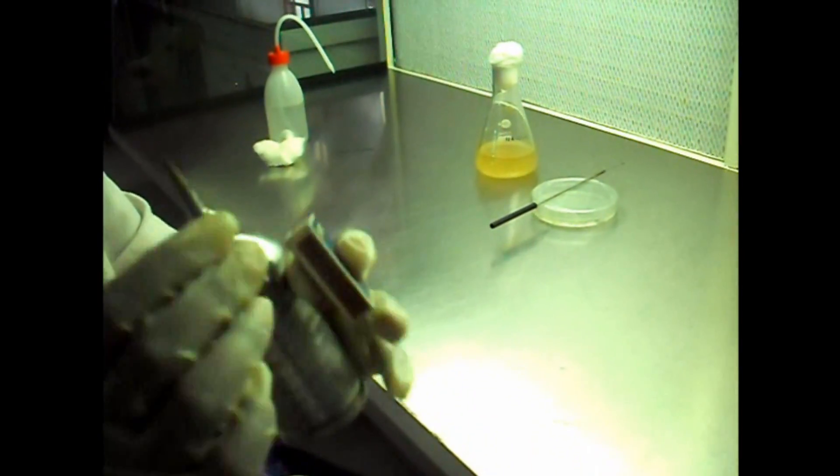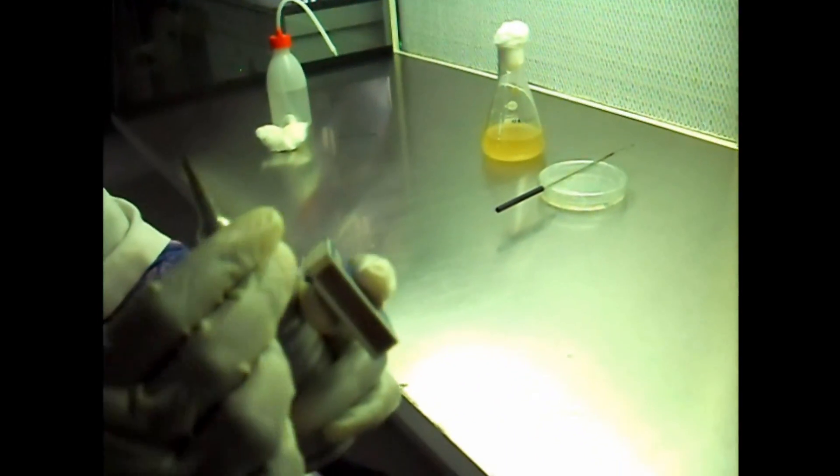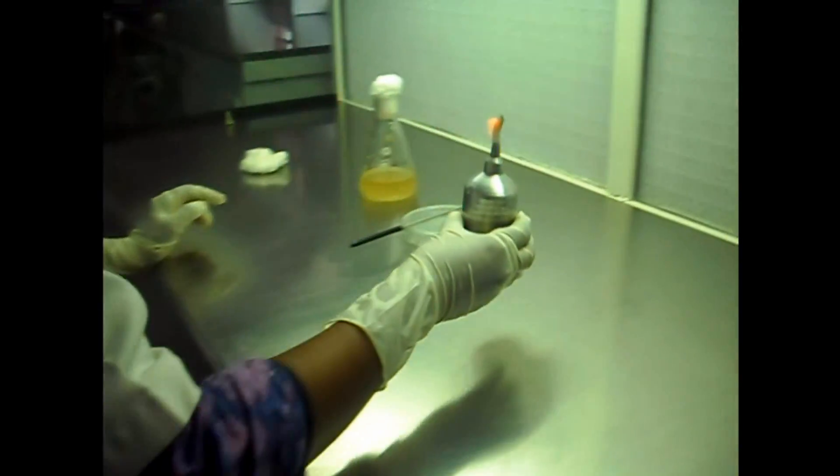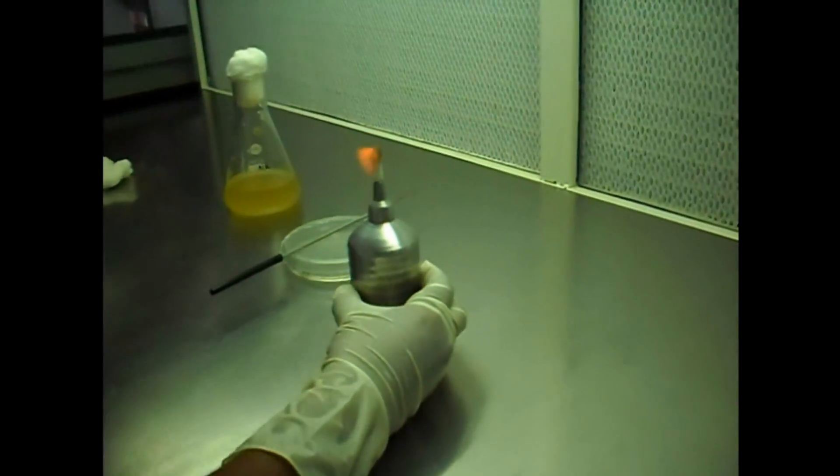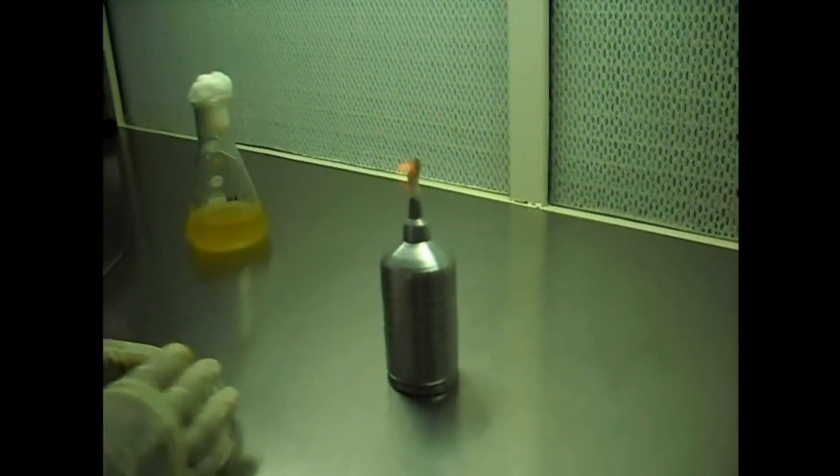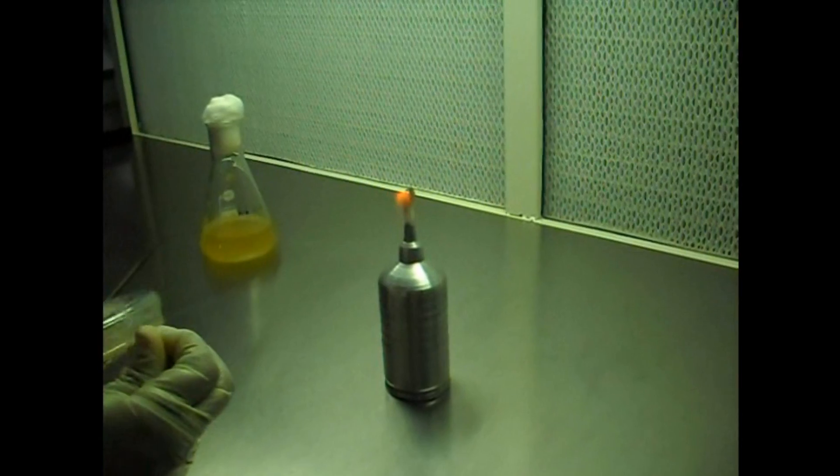Light the spirit lamp in the laminar air flow chamber. Unwrap the bacterial culture.